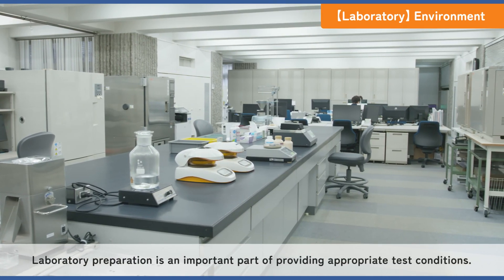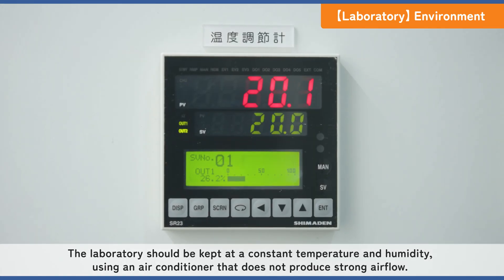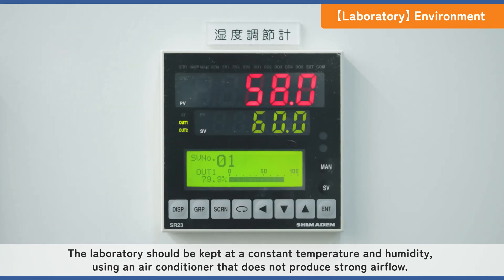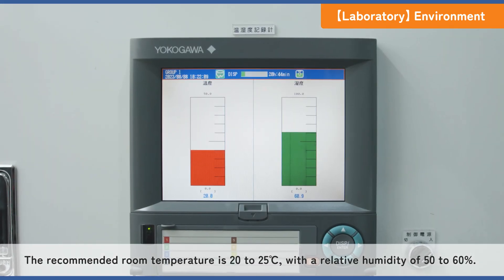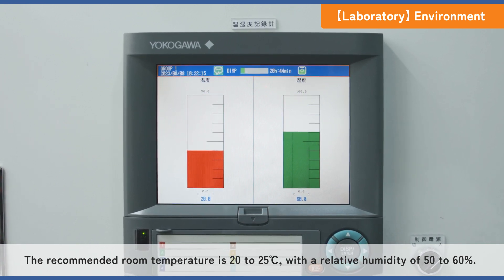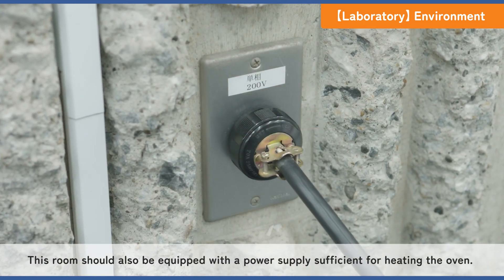Laboratory preparation is an important part of providing appropriate test conditions. The laboratory should be kept at a constant temperature and humidity using an air conditioner that does not produce strong air flow. The recommended room temperature is 20 to 25 degrees Celsius with a relative humidity of 50 to 60 percent. This room should also be equipped with a power supply sufficient for heating the oven.